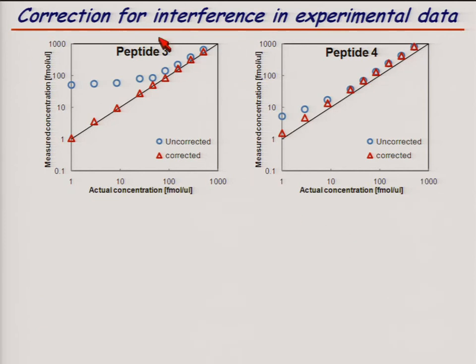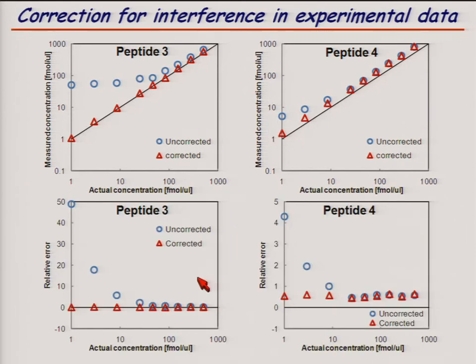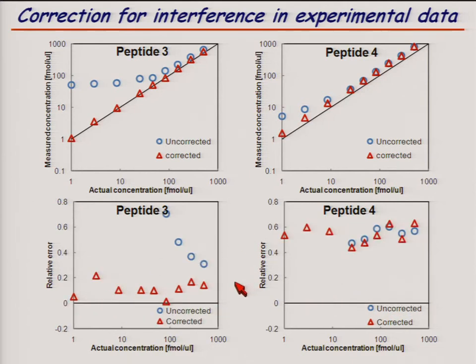And then if we move to the 2 cases where we do have interference, we see that we can correct quite well in both cases. And if we look in detail, we see that the relative error is very large for the uncorrected in both cases. So if we zoom in again on both of these, we see that for the high intensities we get the same errors, but for the low intensities, we remove the interference.